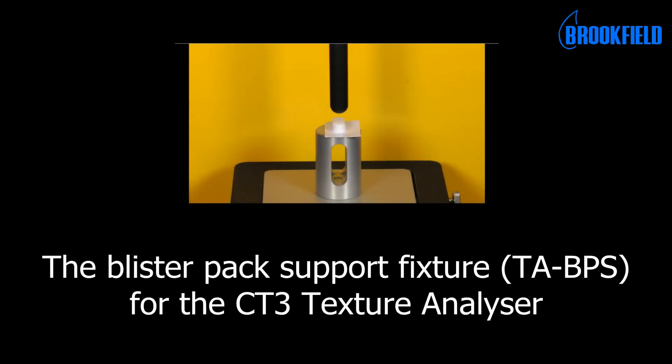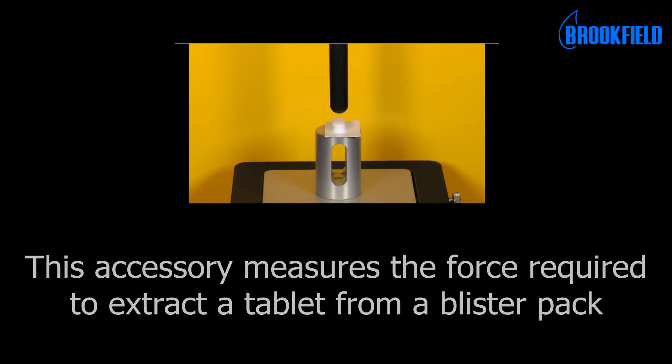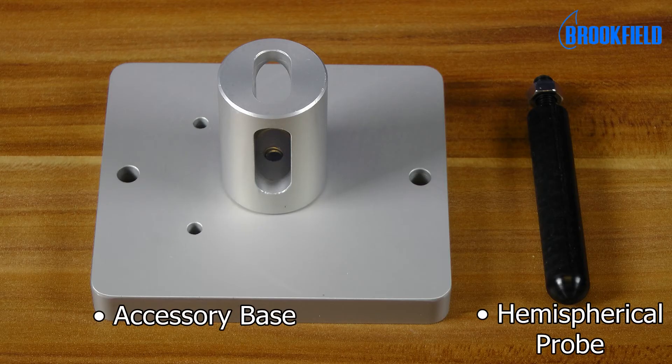This is the blister pack support fixture for the CT3 texture analyzer. This accessory measures the force required to extract a tablet from a blister pack. Here you see the individual parts of the accessory.